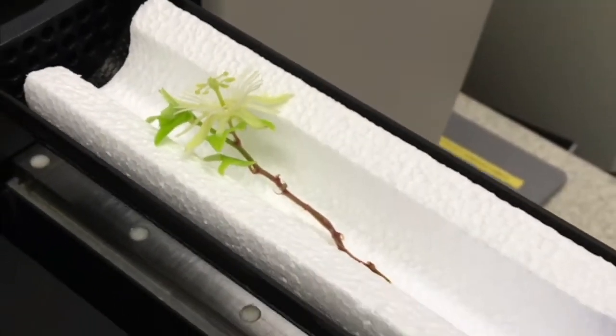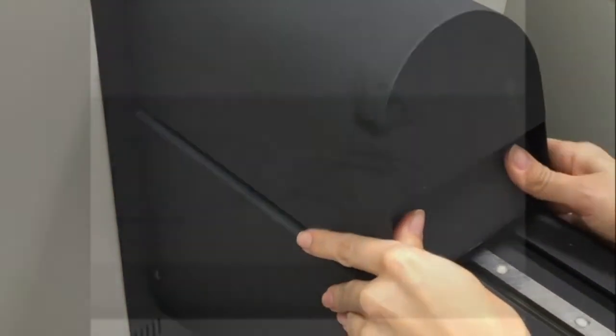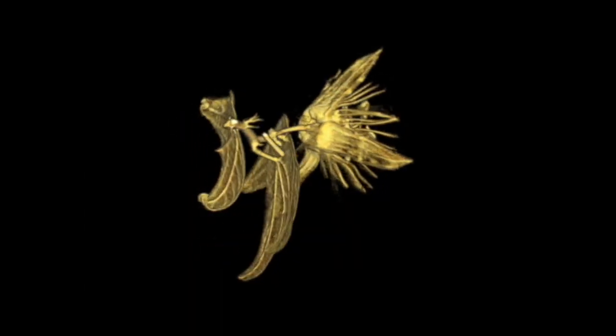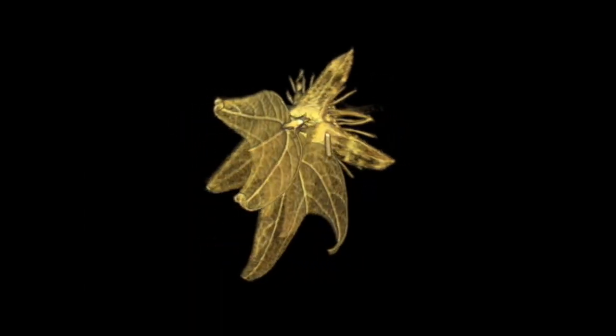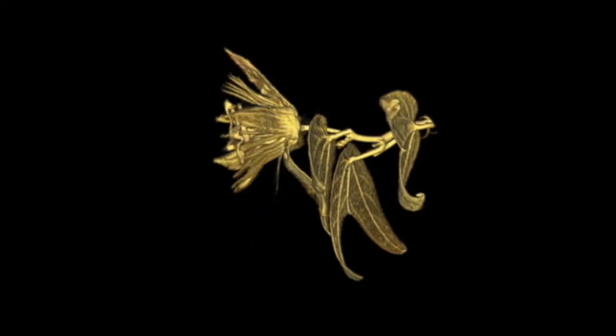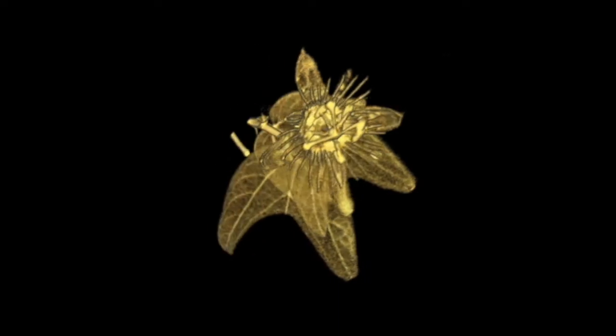Commercially available equipment can also produce images using a fixed object and a moving X-ray source. Some of these machines are so fast that a complete scanning can be performed in less than 10 minutes, allowing the imaging of entire small plants or delicate samples such as freshly collected flowers.